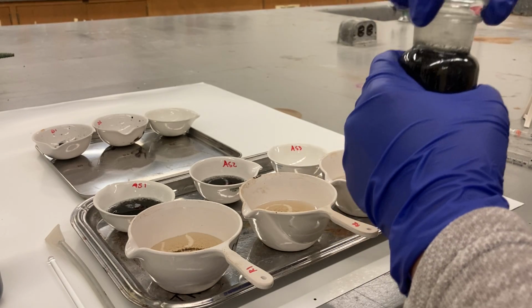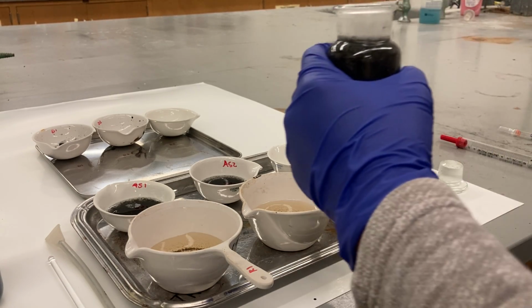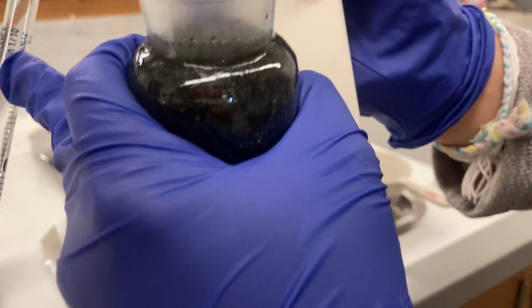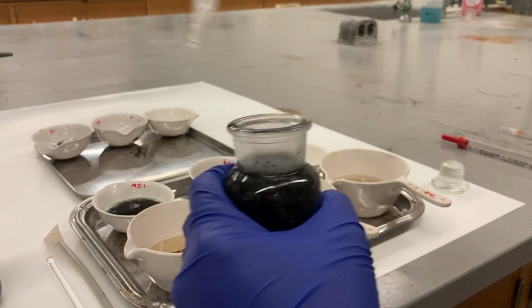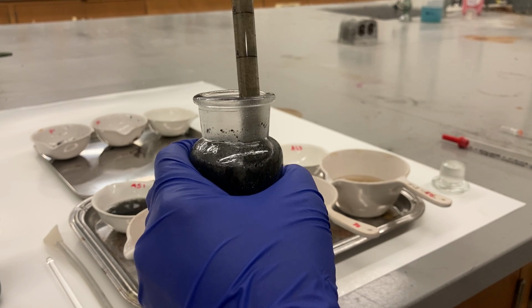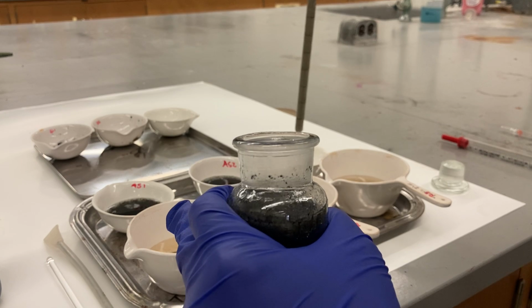Open it. This one is a smaller pipette and the capacity volume here is only 10. It is 10, so I'm gonna do up to here, 10 twice. It doesn't have a lot of solid, that's why it doesn't give me a hard time. It pipettes really easily the first time. Put it in here.